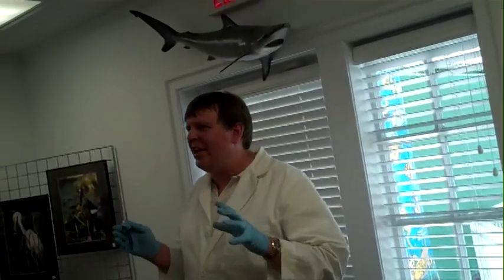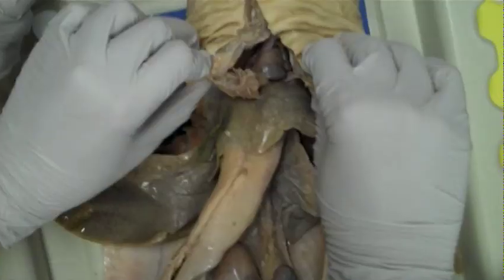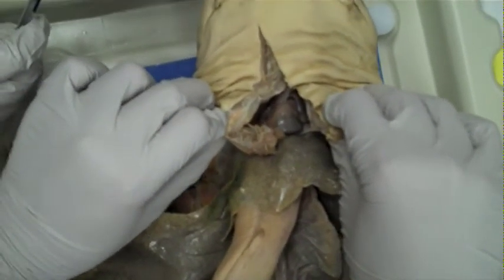There's some questioning about whether it's truly a four-chambered heart. I'm one of the scientists that believes three chambers, and there are others that believe four, so it really is up for debate.